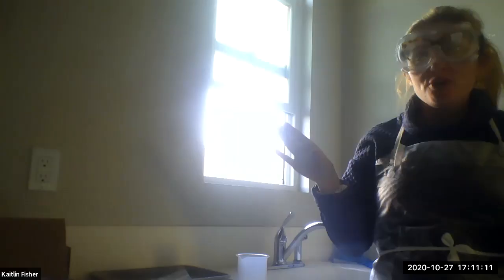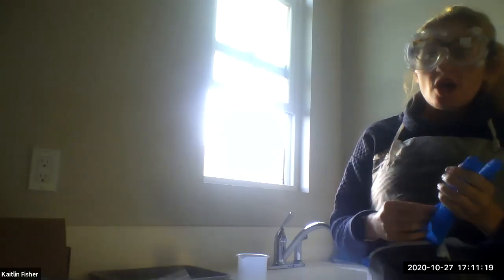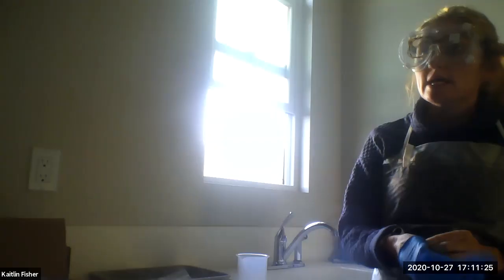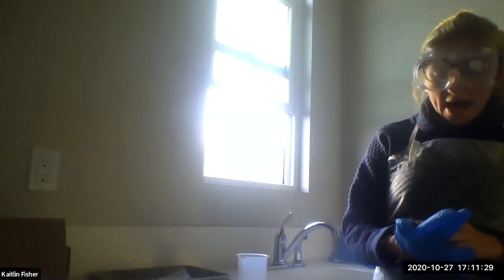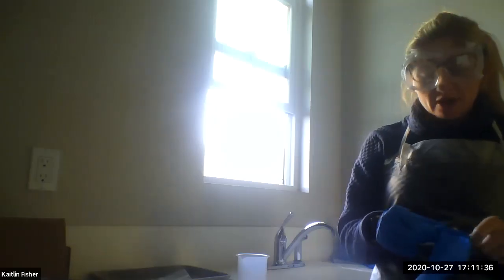I'm reporting to you from my laundry room lab, which you may have become very accustomed to at this point. But what we're going to be talking about today is lab number 7, which is the synthesis of aspirin, or acetylsalicylic acid. Today's lab is pretty straightforward in terms of setup. It's very contained, very little equipment involved.